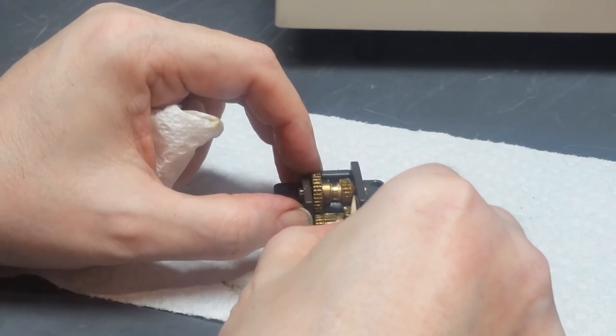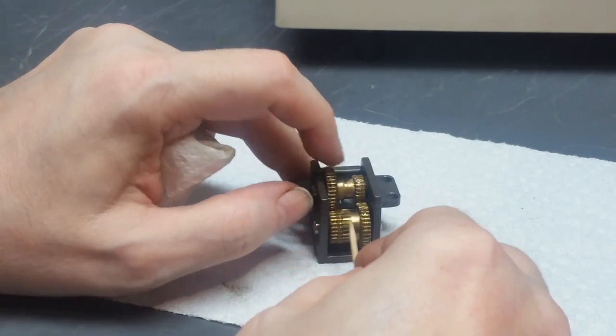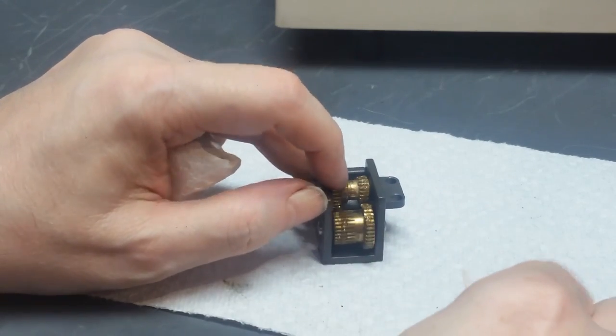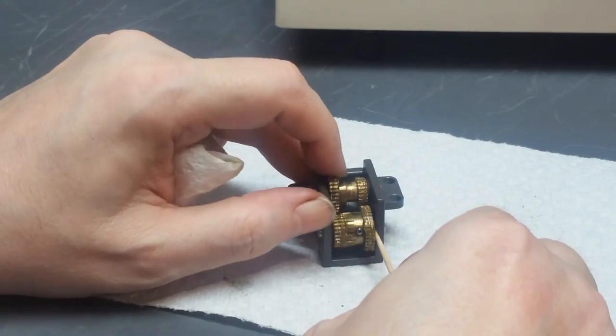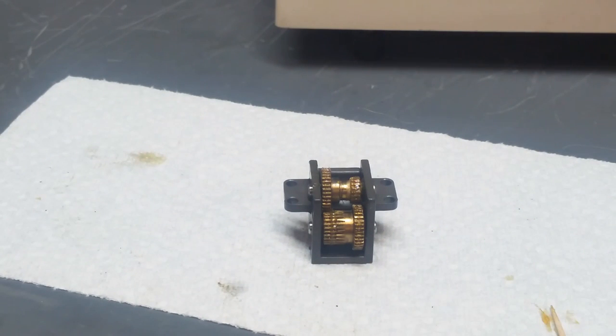Now I might at least make an effort to take off the big globs of grease that aren't doing anything other than just mucking up the works. Spread it out a little bit, make sure it all runs free. And I'm ready to install the gearbox.